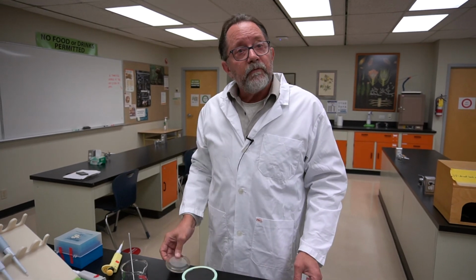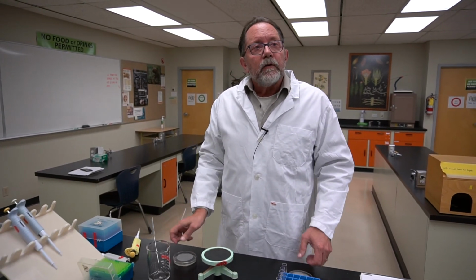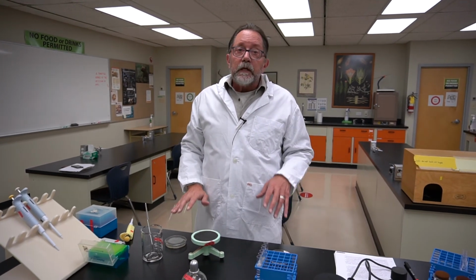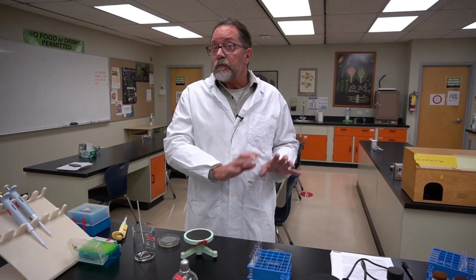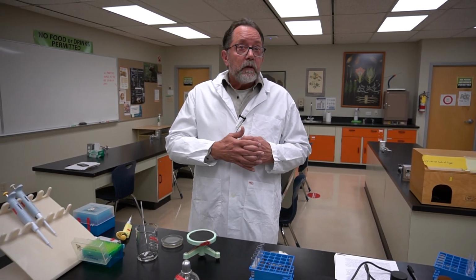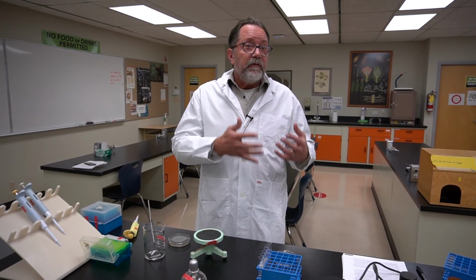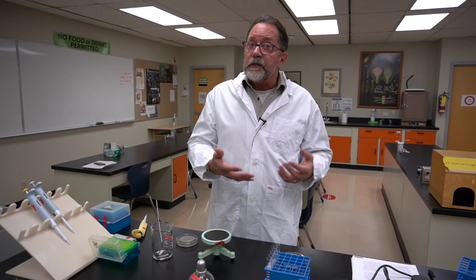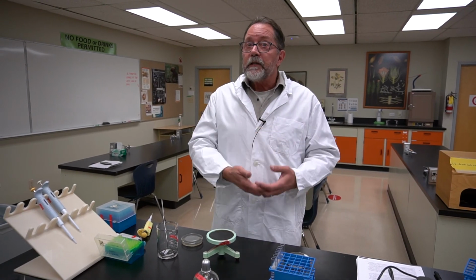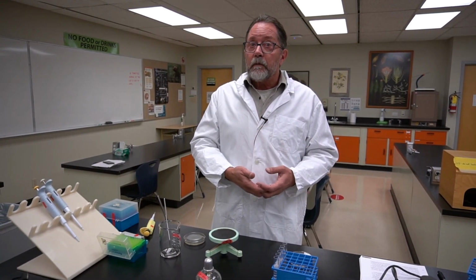In the last point for now, the reason we have to do these separate experiments is because the killing effect is really quite profound. At 30 seconds, you will find that there's very few colonies growing. Maybe only 1% of the cells survive a 30-second dose of UV.